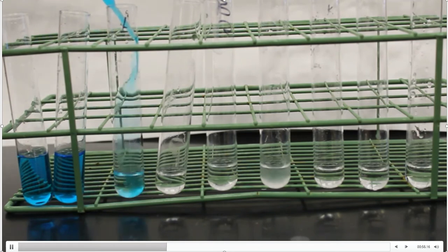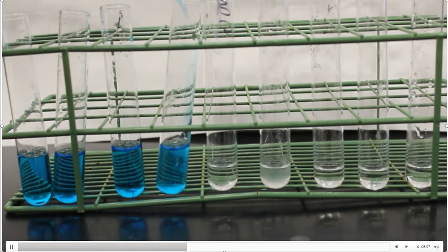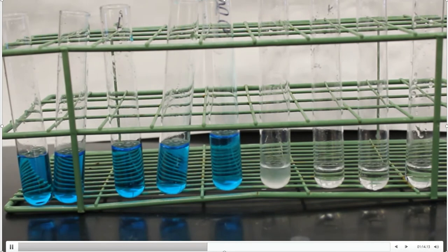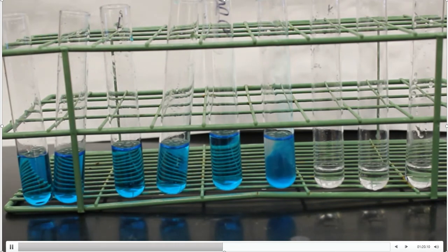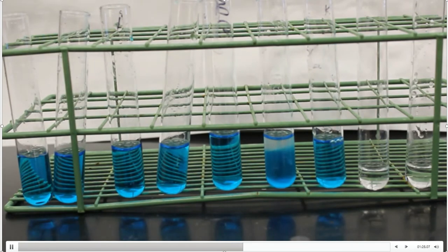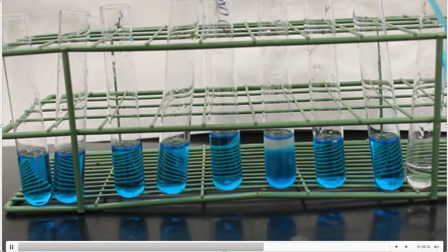Again, it's qualitative — I don't need to be pipetting or exact. If a reaction is going to happen, it's going to happen. After I add the Barfoed reagent, notice that all of these so far are blue; there's really no difference in them at all. There really shouldn't be because the next step tells me to put them in a hot water bath. So I'm going to put these into a hot water bath for five minutes, take them out, and see if there are any differences in the test tubes at that point.